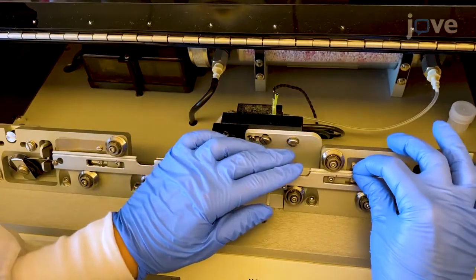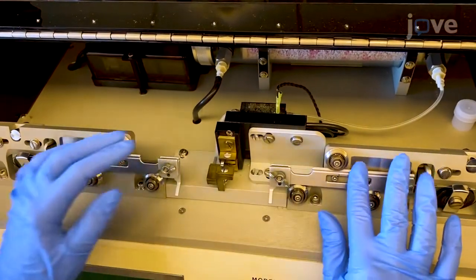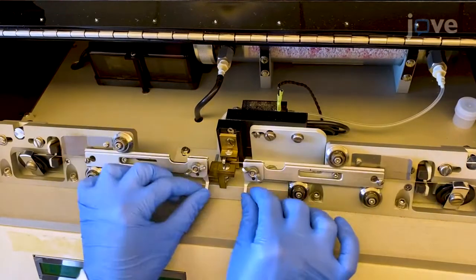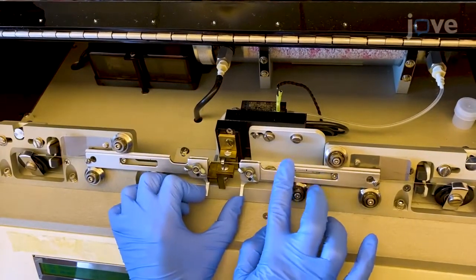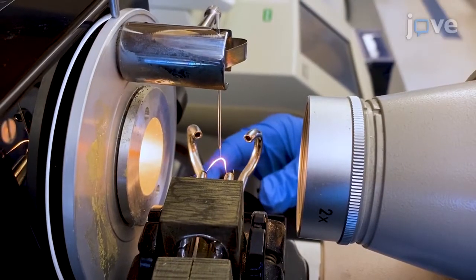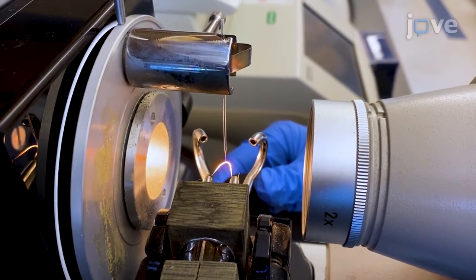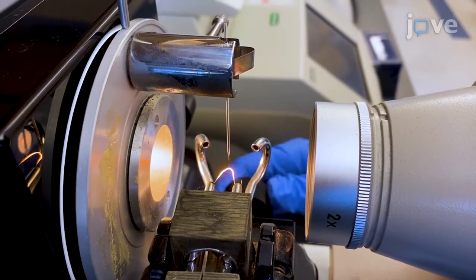Place a 10-centimeter long borosilicate glass capillary tube in a mechanical puller to prepare injection needles. Bend the needle tip at a 45-degree angle using a heated filament for optimal injection.